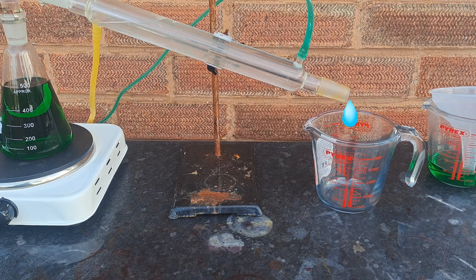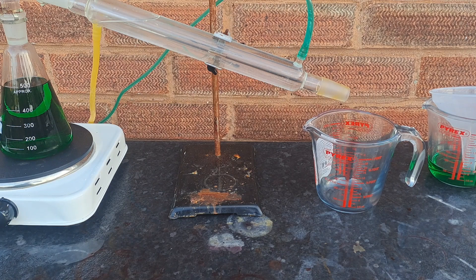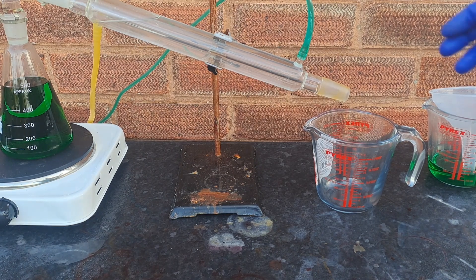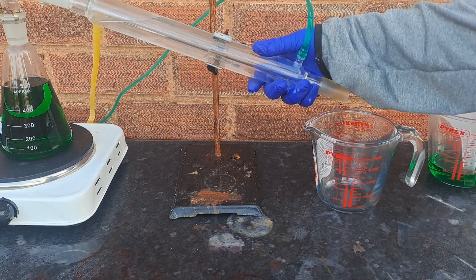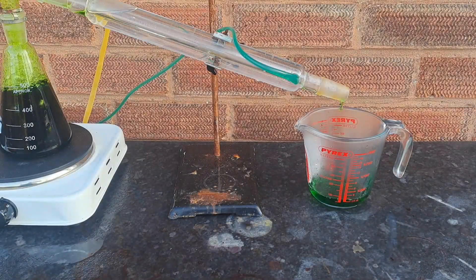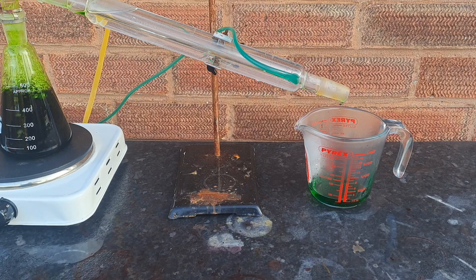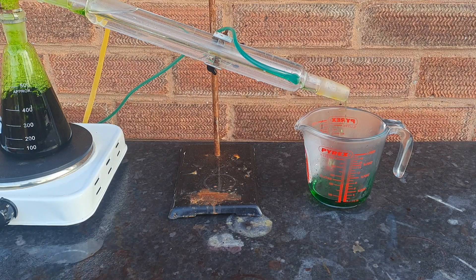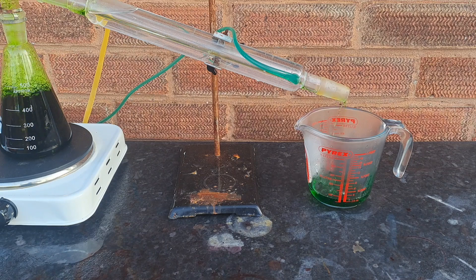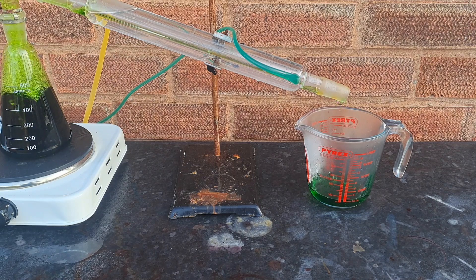At this point, if you were to continue to heat the residue, the copper(II) chloride will begin to decompose to copper(I) chloride and chlorine gas. I'll let this run and get back to you once it's finished. Make sure you don't overfill your boiling flask. As the liquid expands, it needs a bit of room. Without it, the solution will boil over — and this happens. I'll clean this up and get back to you when the distillation is complete.